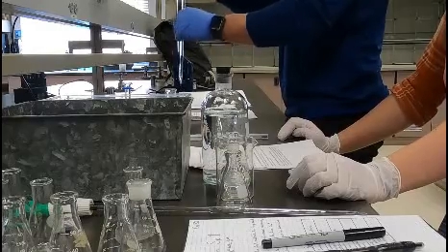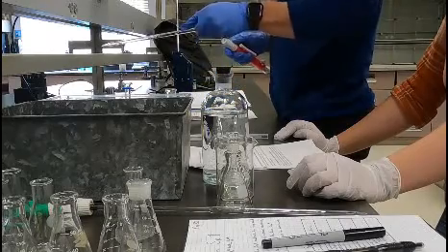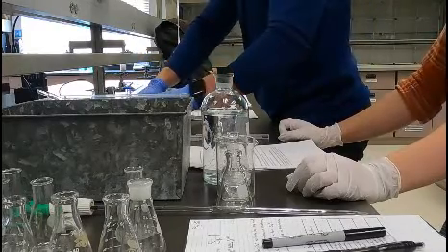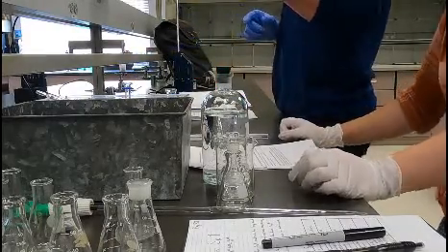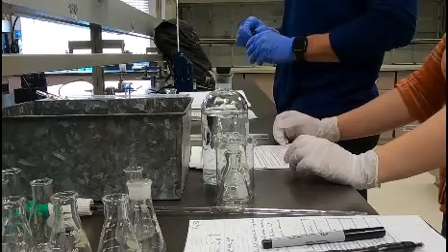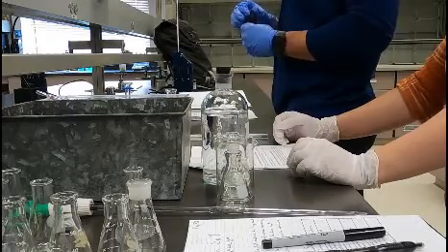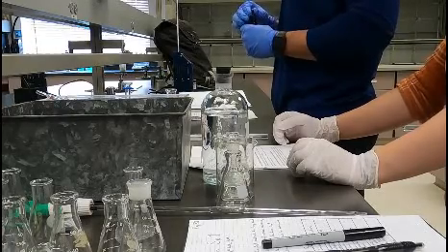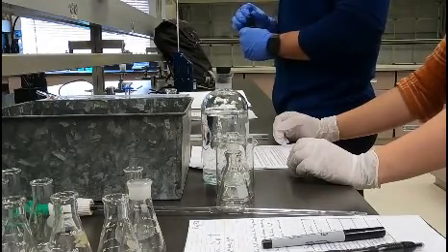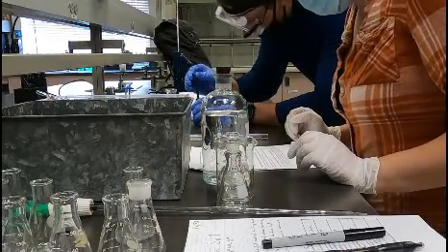I have people who are going to be gone for two weeks because of COVID. So don't ever turn those upside down — it might go into the pipette. Same with the ones when you use the little rubbers on the disposable glass ones. Never invert. Next semester there will be a lab where you guys use the disposable glass with the rubber stoppers — if you invert those and get some of those rubber stoppers, the acid just eats them up.